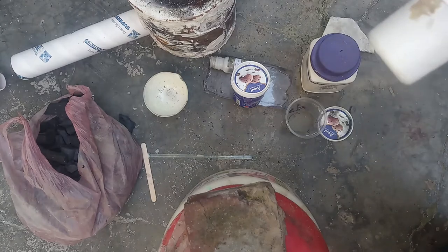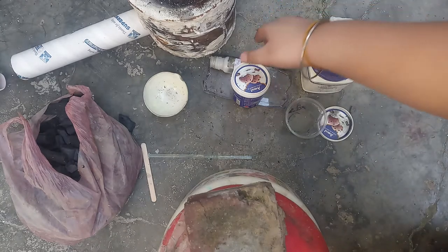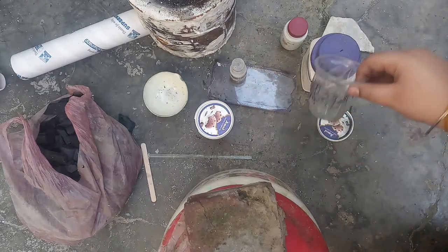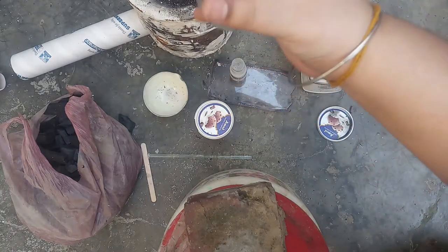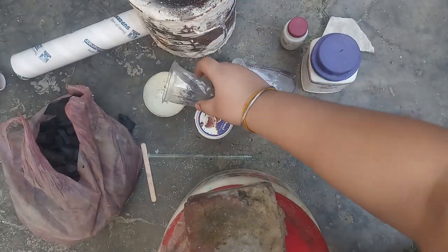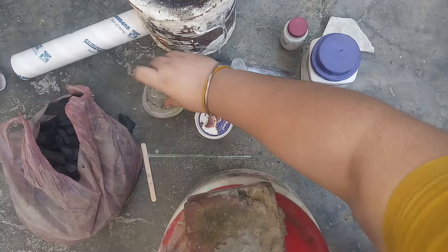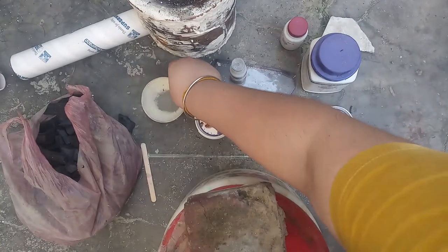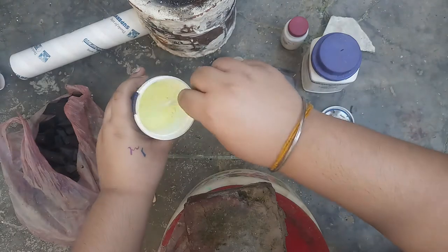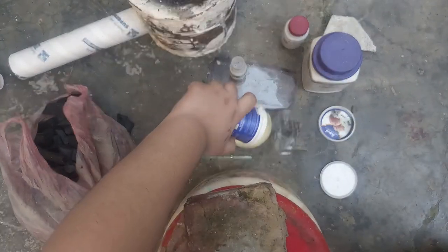Let's start. Dissolve and mix 15.35 grams of zinc in a crucible, and mix 17.49 grams of sulfur powder.